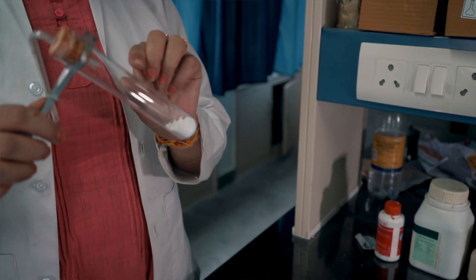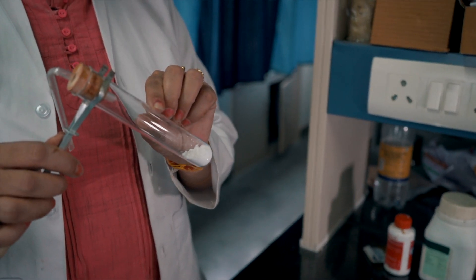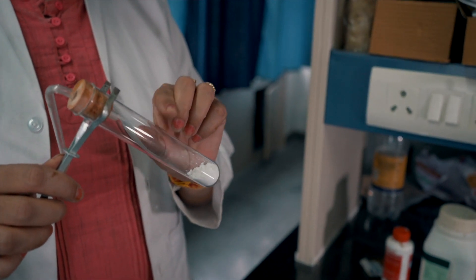In this experiment I will explain the thermal decomposition of zinc carbonate. When zinc carbonate is heated, the residue is zinc oxide along with carbon dioxide gas. The residue is yellow when hot and white when cold.